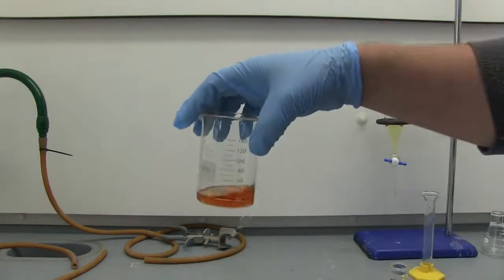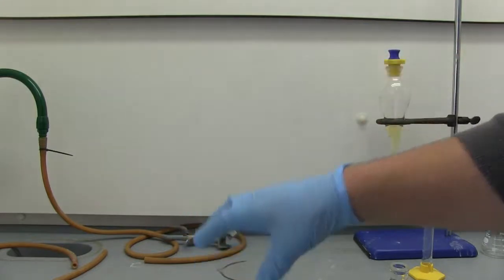All right, looks good. All right, so now we'll just evaporate this, put in a beaker of warm water to get our crude product.